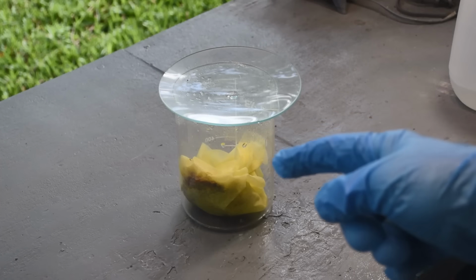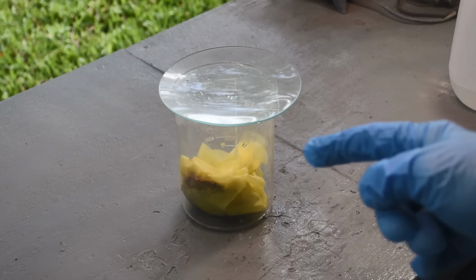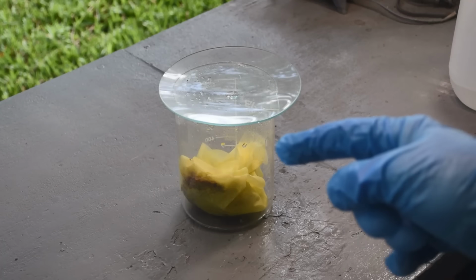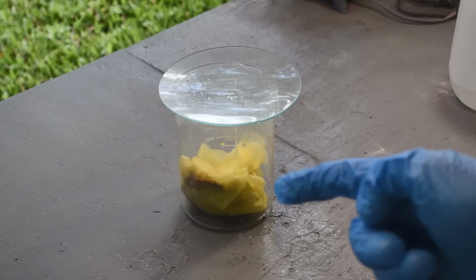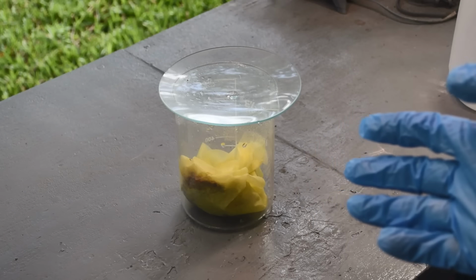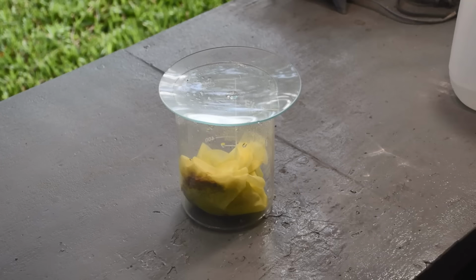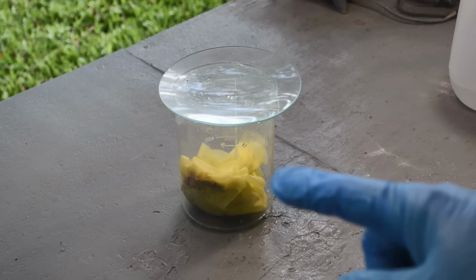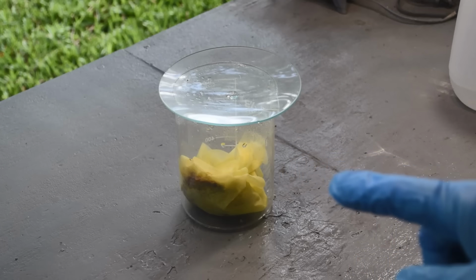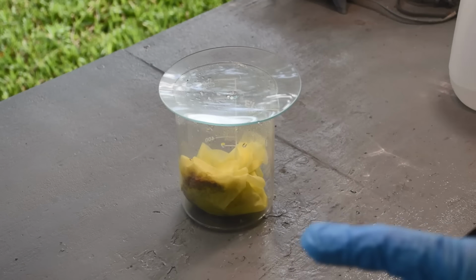I mean, one, I could just put this stuff in a quartz dish and put it in my cupelling oven and heat it up and burn off the paper and sublimate away the ammonium chloride, and eventually we'll wind up with palladium metal. But I think we've got some contamination with base metals here, so I'm leaning towards a different method.